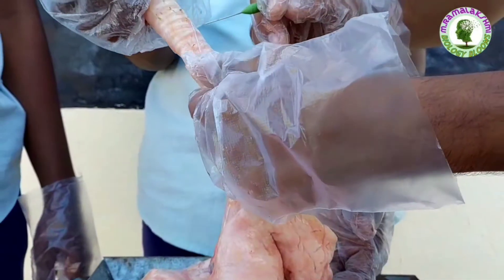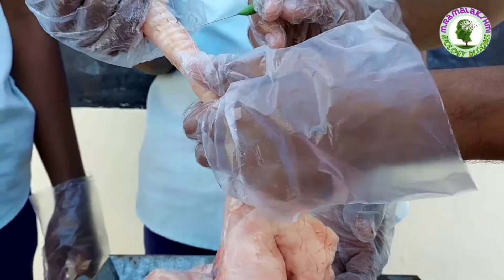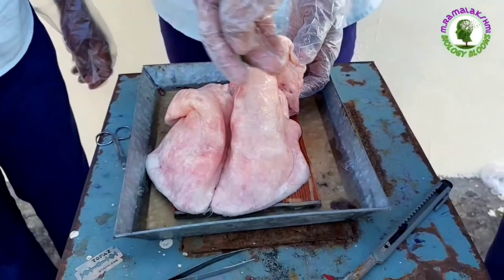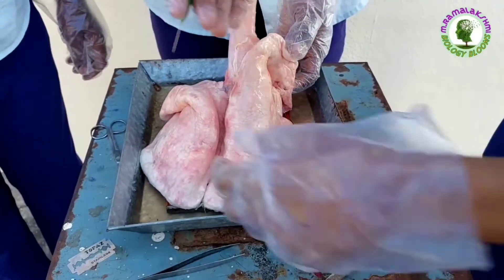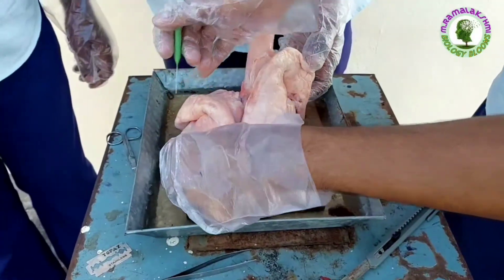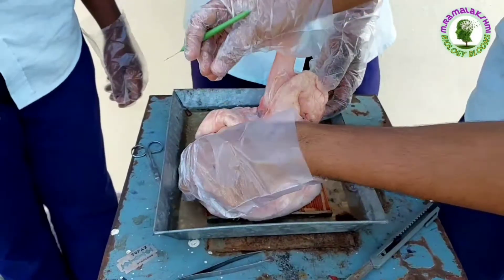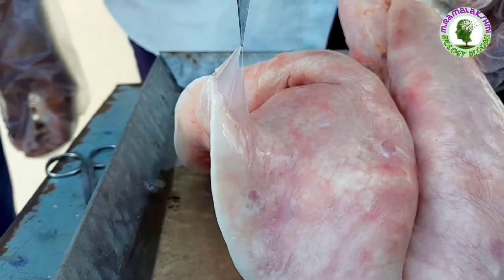Now we are observing trachea. This is right lung and this is left lung. For protection it is covered by two membranes named pleura.